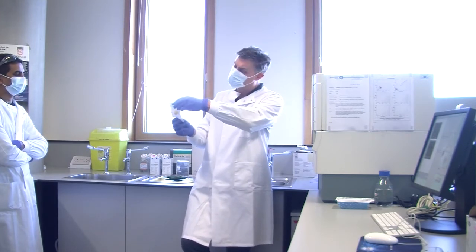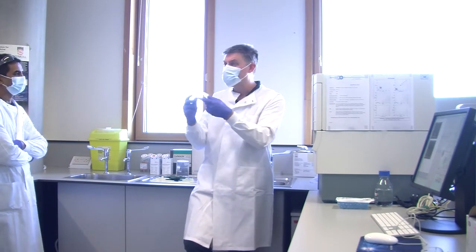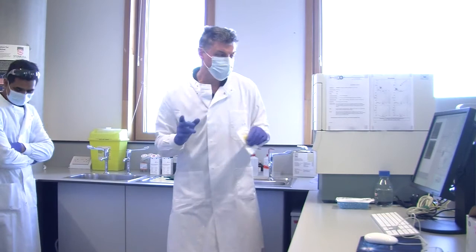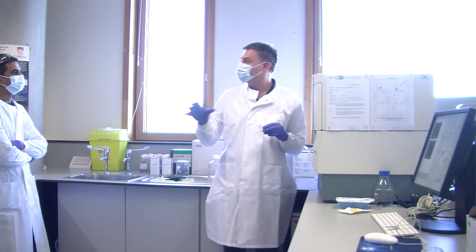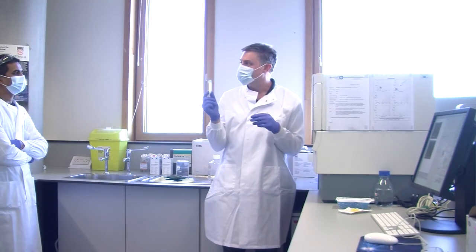This is a Celltrics one. That's a 60 micron. So the grid in there will let cells through that are 60 microns or less, so you're not going to block it. However, what I would say, and this is for your future careers rather than for today, is that from a data point of view, be careful.